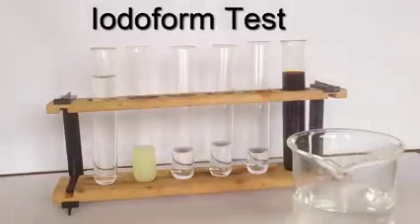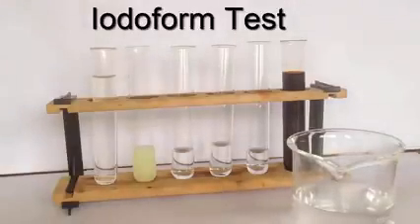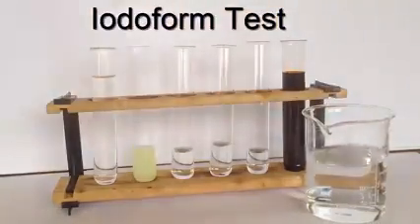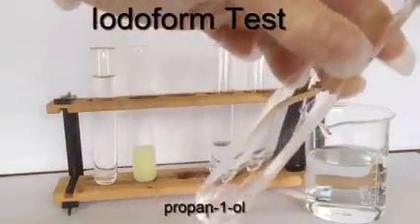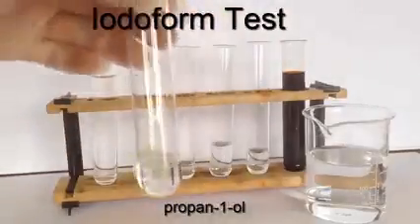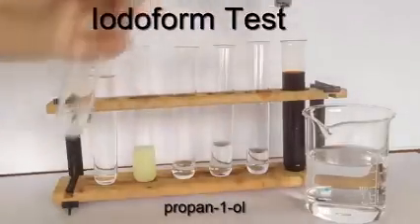So let's move on to the next alcohol, which is propan-1-ol. Consider the structure of propan-1-ol and whether or not you think it will give a positive iodoform reaction. So again, I'll take some propan-1-ol in a separate boiling tube, much greater volume than one would use normally for these tests, just so that it shows up better on the camera.